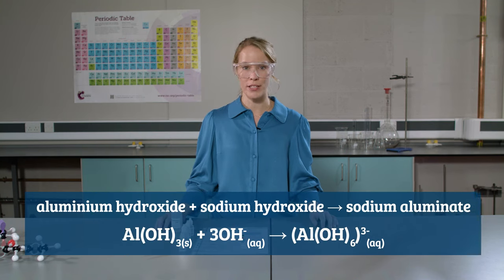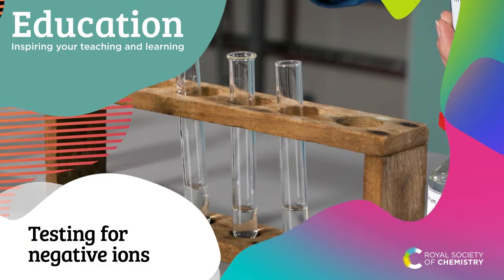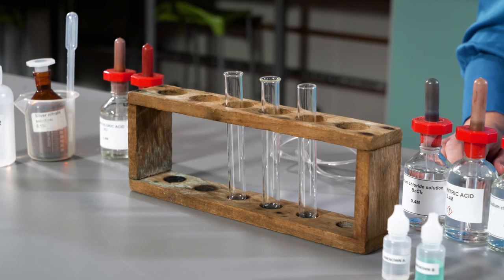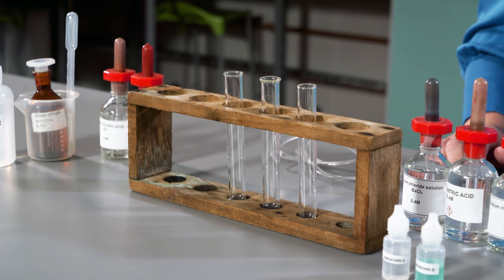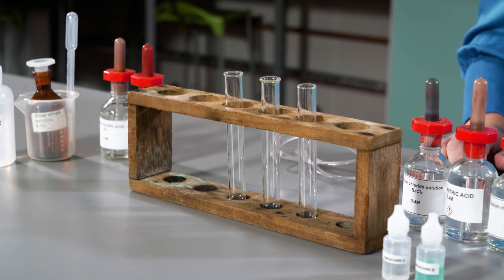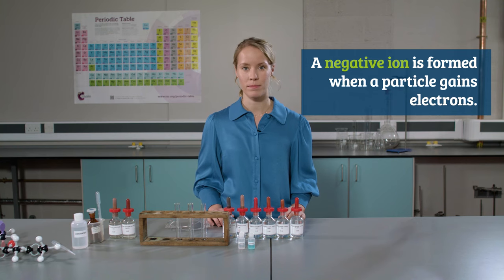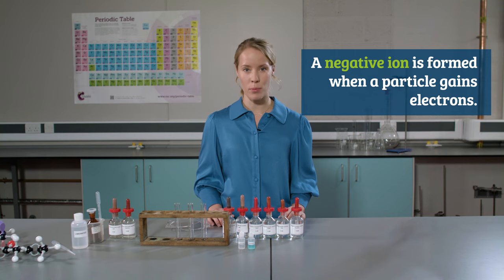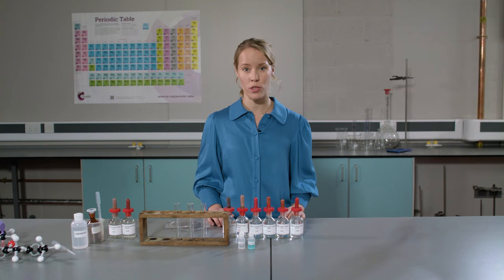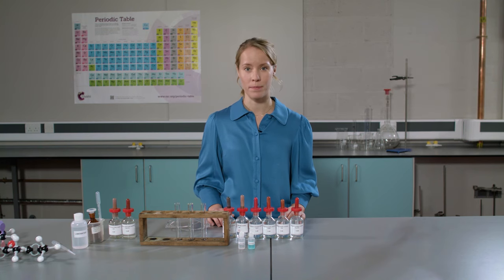Here is the equation for the reaction. In this section we are going to carry out chemical tests for carbonate ions, sulphate ions and halide ions. These are all negative ions. During the reactions it's important that you make careful observations and record your results in a results table, so that you know what the positive result looks like.